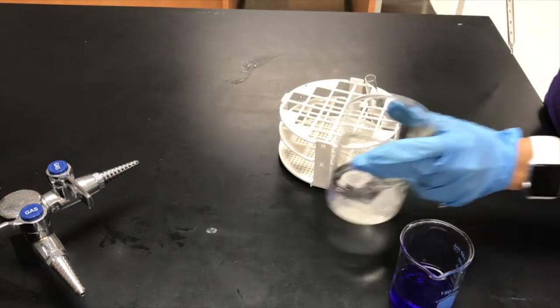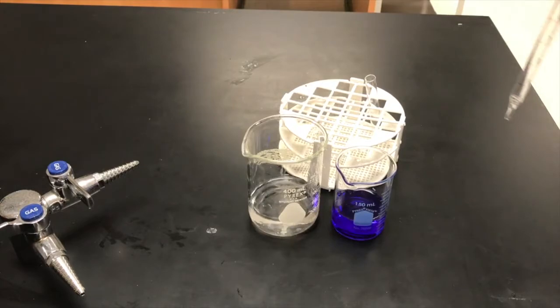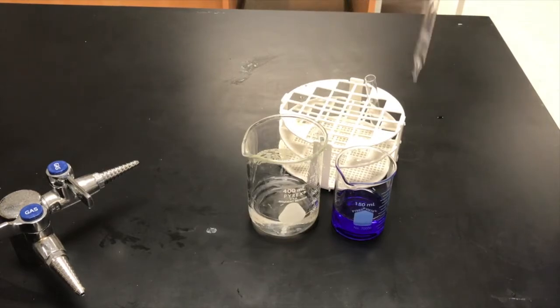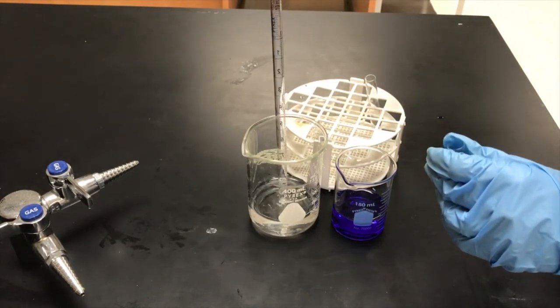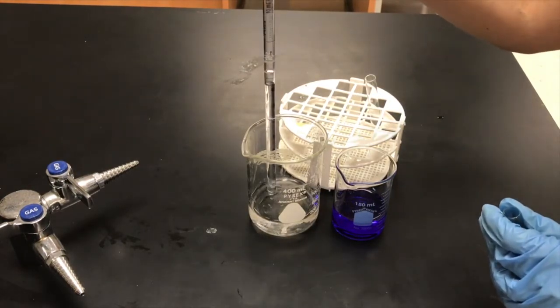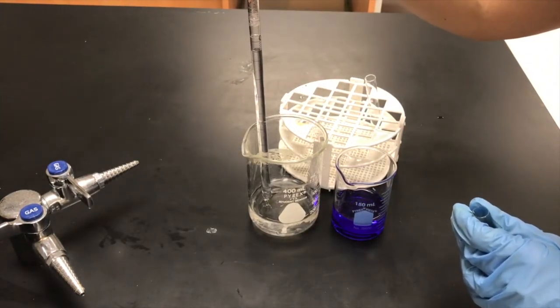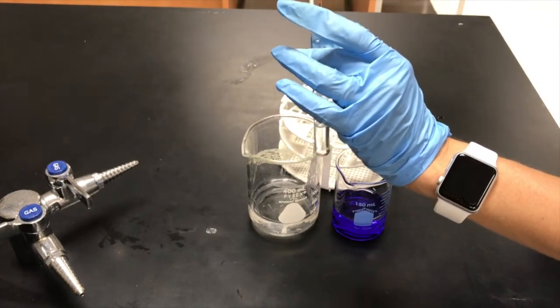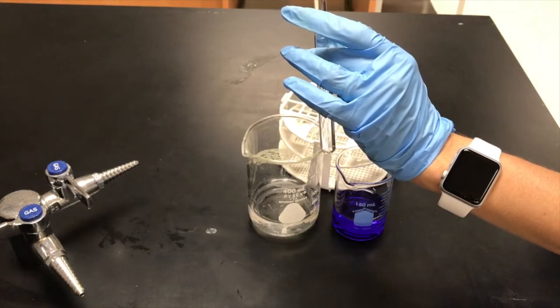The best way to prevent contamination is to first add water and measure the correct amount for every single cuvette, and then add the crystal violet. I want nine mils, so I'm going to add that in. If I were doing this in the lab, I would then add the next correct amount of water to the next cuvette and so on, until I have all my different concentrations of solutions.